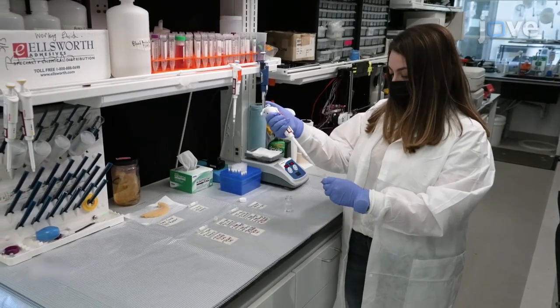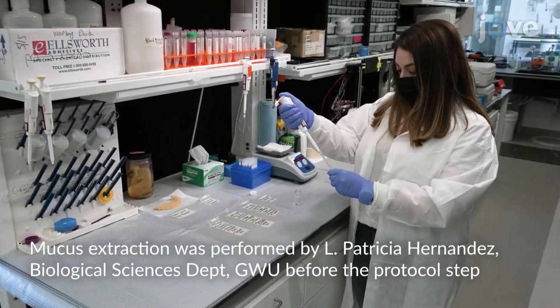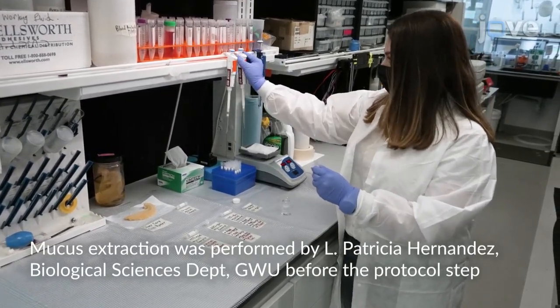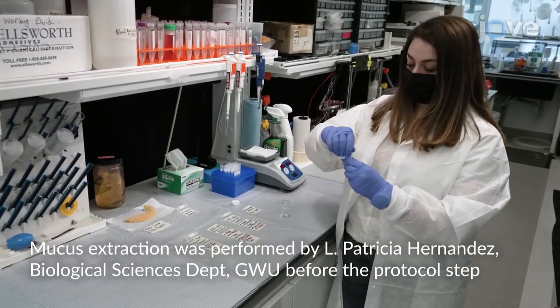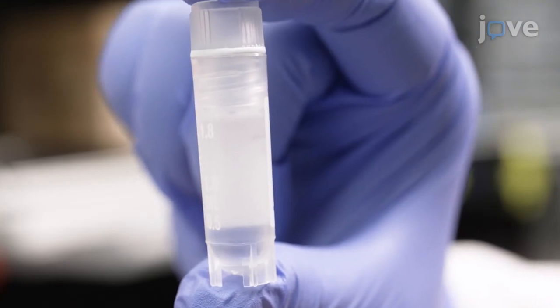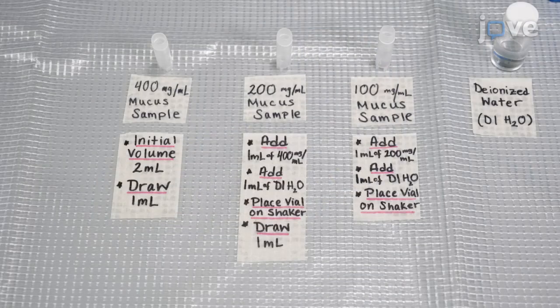To prepare approximately 2 milliliters of 100 milligrams per milliliter concentrated fish mucus solution, perform serial dilution of 2 milliliters of 400 milligrams per milliliter concentration by adding deionized water in 1:2 ratio twice. Place the vial of mucus solution onto a shaker until the solution is adequately homogenized and any mucus particulate agglomeration has been mitigated.